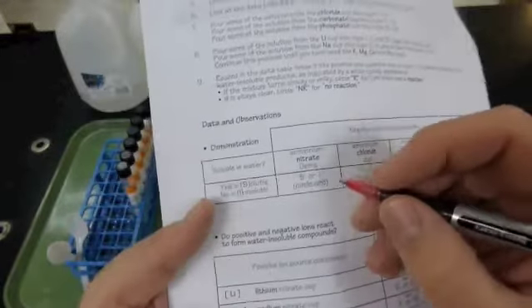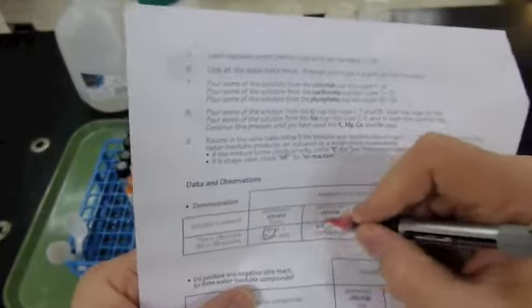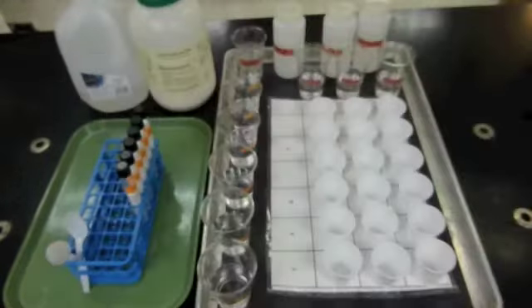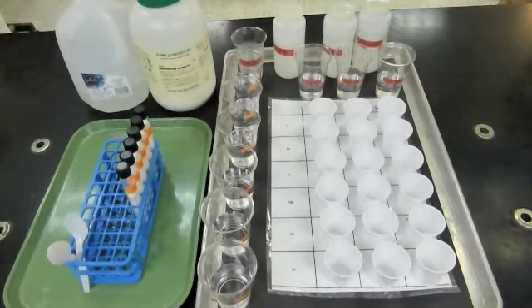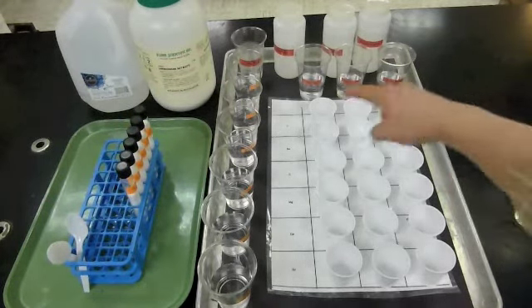So the one that I showed you, ammonium nitrate, I would circle that it's soluble because it made a clear, colorless solution. And the other ones, ammonium chloride, ammonium carbonate, and ammonium phosphate, those are all soluble as well. When you look at their cups, they're clear, colorless solutions. The metal-nitrate solutions that you're making, they're all soluble as well, so make sure that they're mixed until they're clear and colorless, and then mix them in the cups.